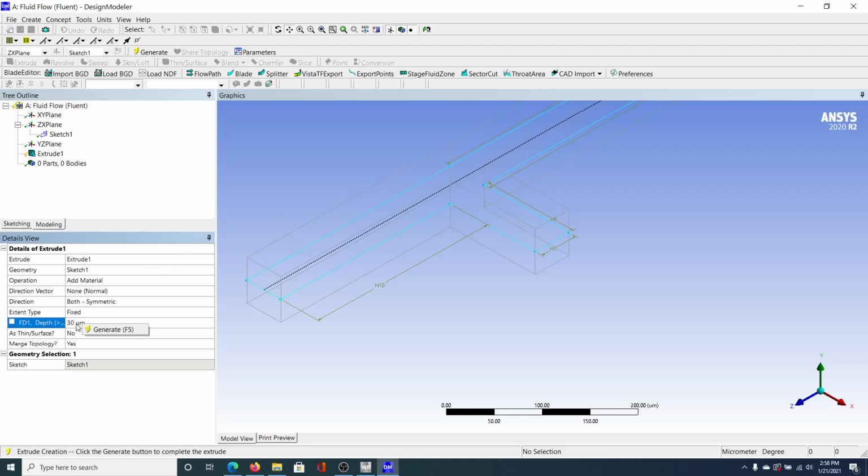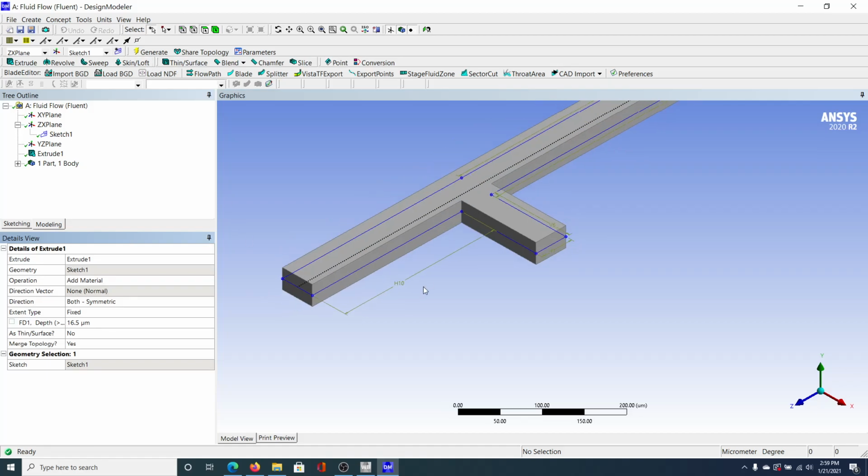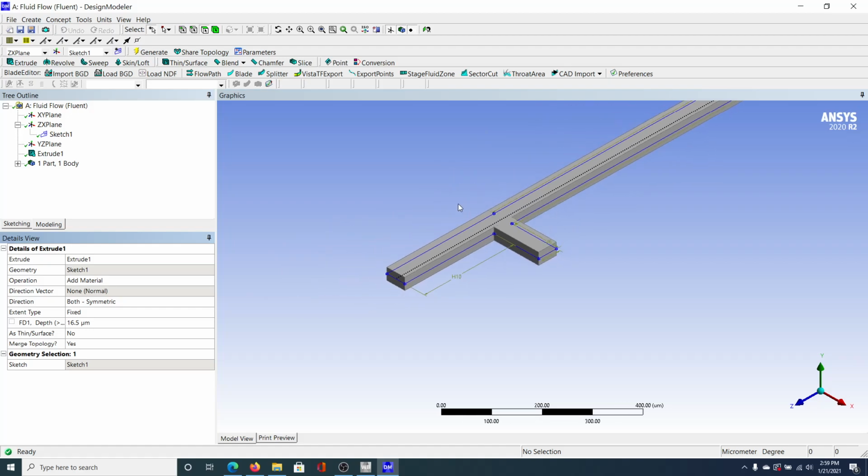And then the depth that we're doing, let me see. I believe the channel was 33 micrometers high. So we should do half of that, which is, what is that, 16.5. So we're going to make this 16.5. And then, just verify. It should be good. I think we're good. So then generate. All right, yep. So it added it. So I believe that's it for creating the geometry.